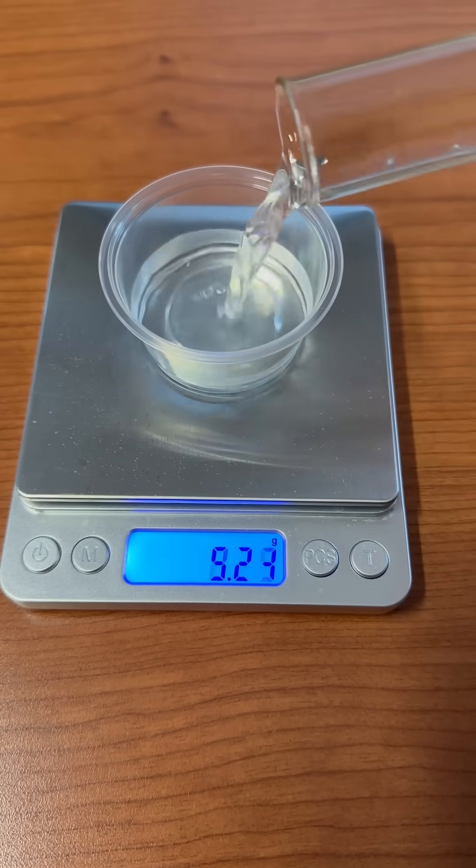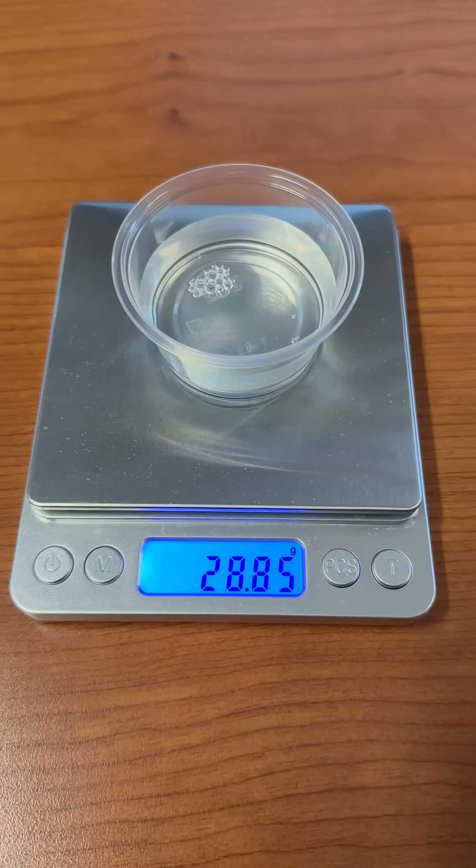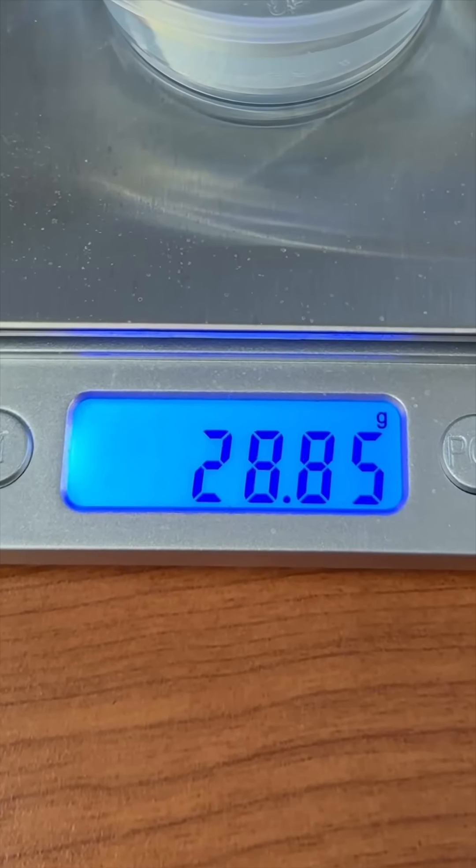I'm going to react the magnesium metal with some acetic acid found in vinegar. That's 28.85 grams of vinegar.